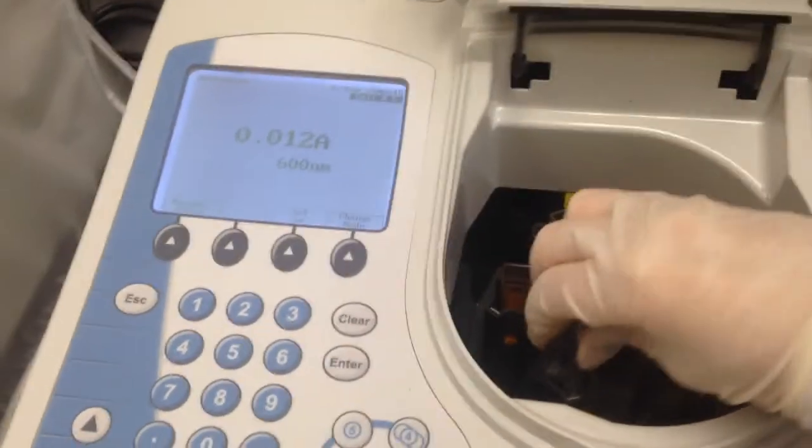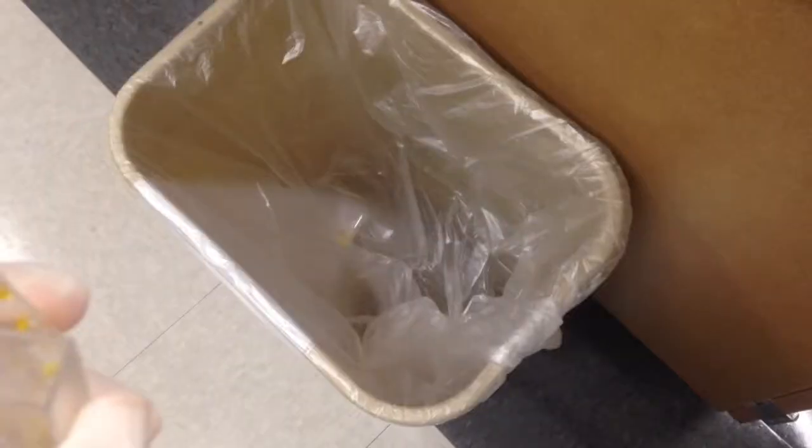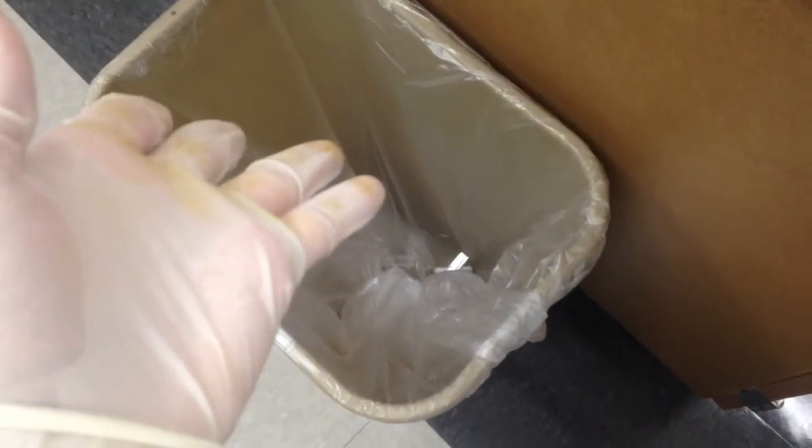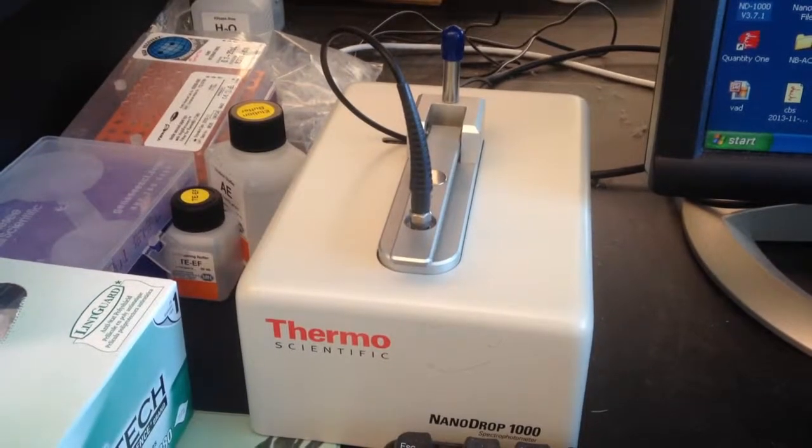Once you're finished with the machine, go ahead and remove your samples. Turn off the machine, of course, and properly dispose of your cuvettes. And that, ladies and gentlemen, concludes the spectrophotometer demonstration.